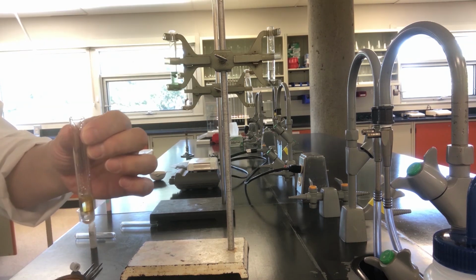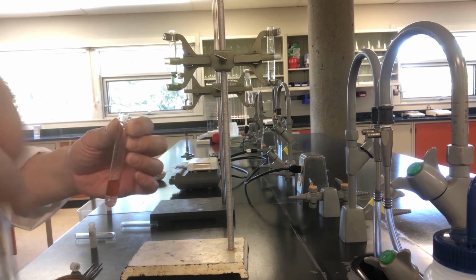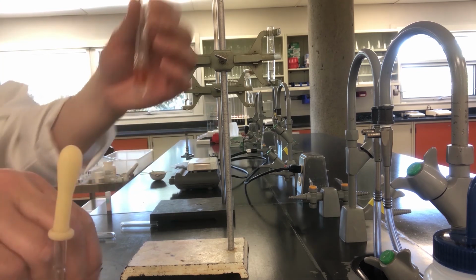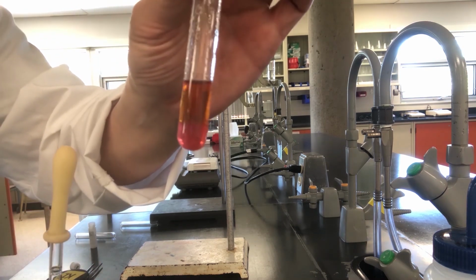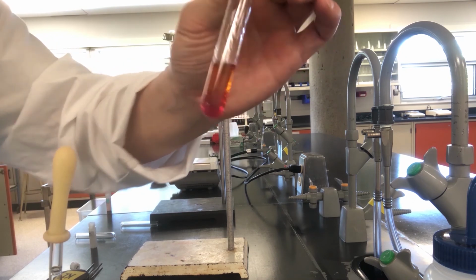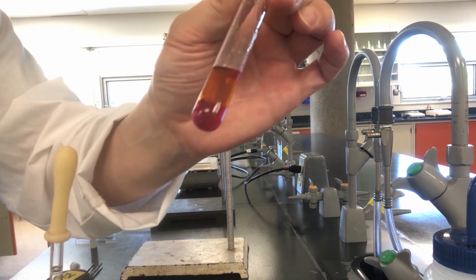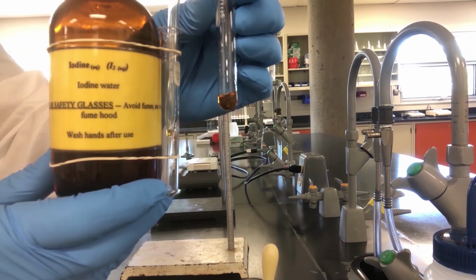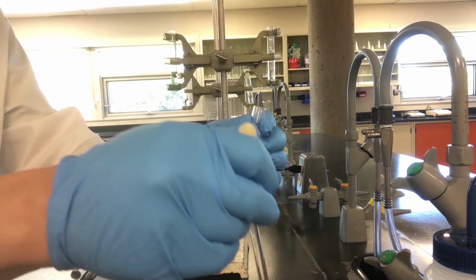Now let's add in the reactant. I added 1 ml of potassium iodide. Let's cap and shake again. Notice that the bottom is now colored. What happened? This is the color of iodine in dichloromethane. Let's see if the reverse reaction will occur. If successful, then chlorine should be produced, and remember that chlorine is colorless in dichloromethane.